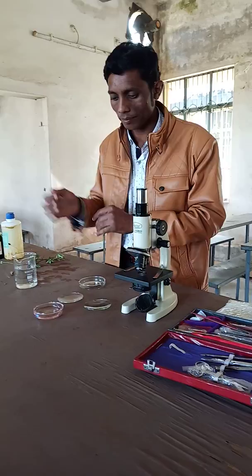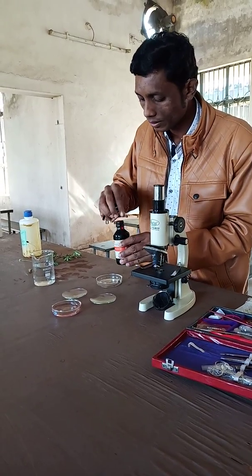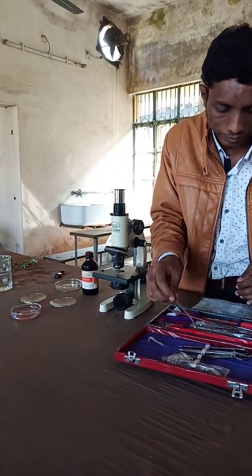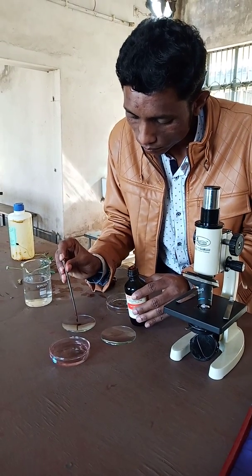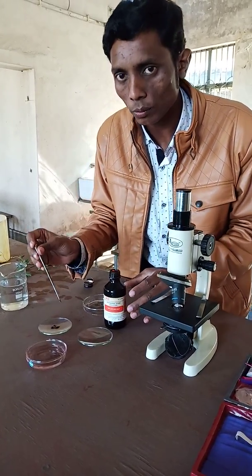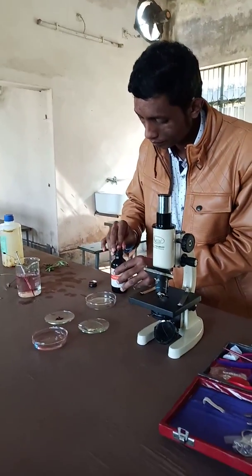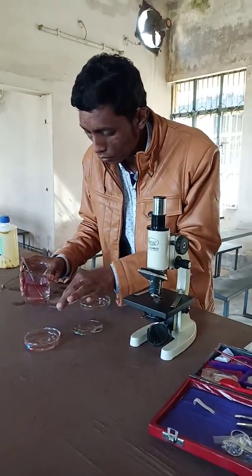First of all, here we have watch glasses. Let us take safranin — you can take one to two drops of safranin into the watch glass. We have now taken safranin in the watch glass, and next we add a little bit of water here.